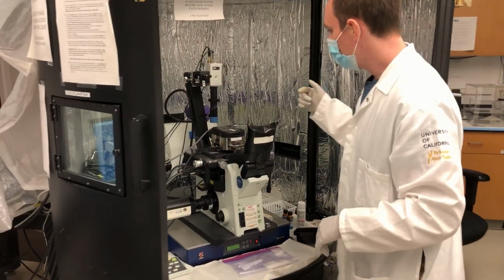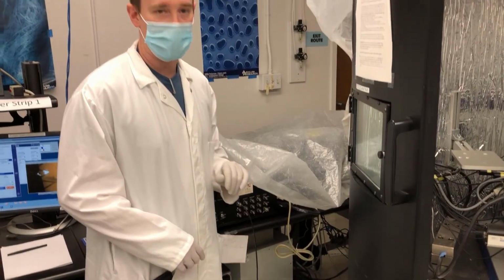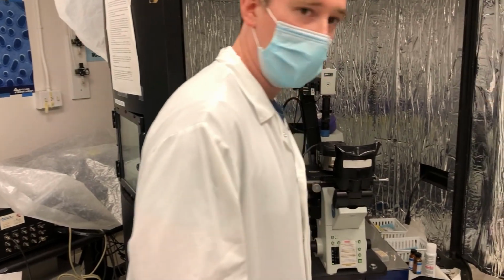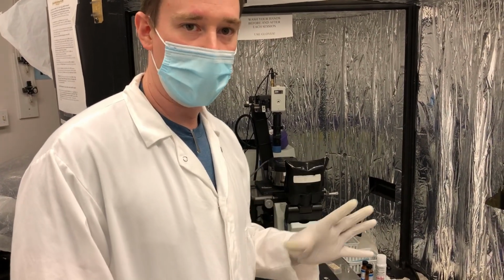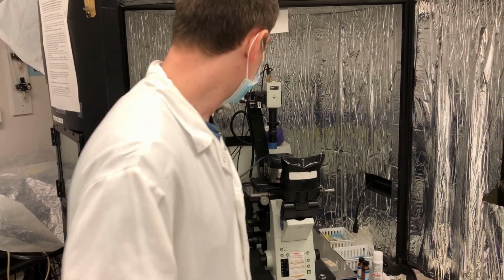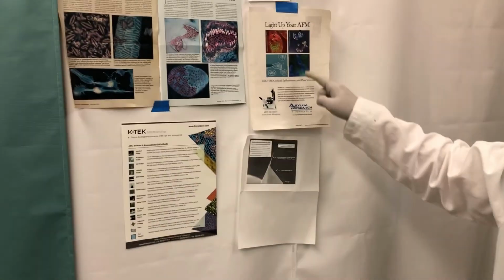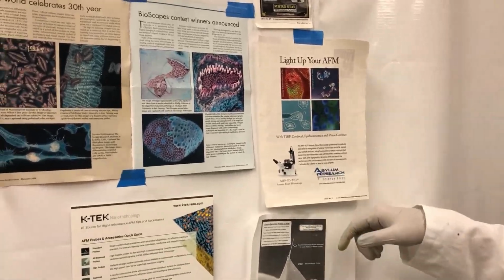For the confocal, we have an assortment of lasers, about 9 to be exact, and they would go through these fiber optic cables, through the inverted microscope, through an objective, strike the sample depending on what your emission wavelength is, and would hit a photomultiplier tube that is back here. And you would see images such as this with a confocal microscope, detailing, say, nucleic acids, proteins, or the actin filaments.